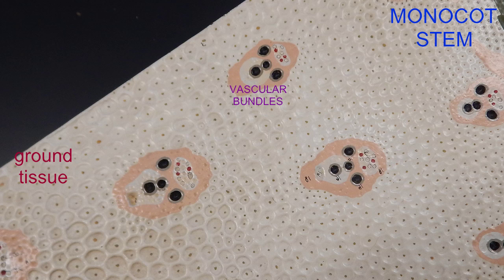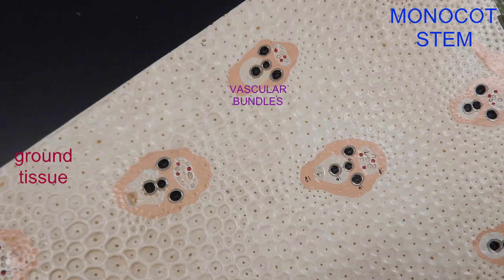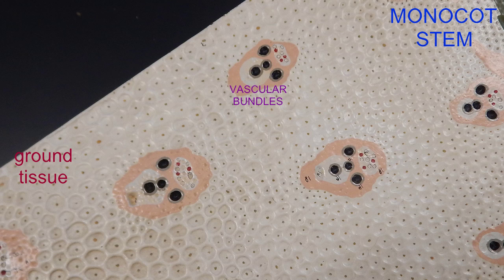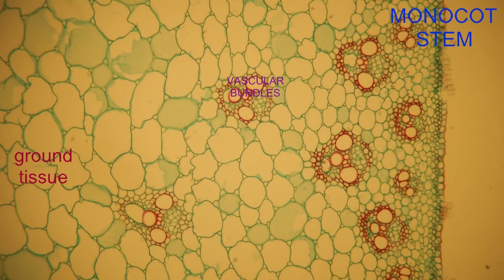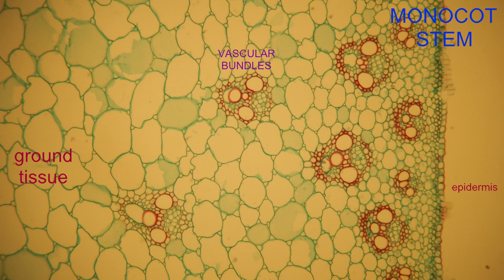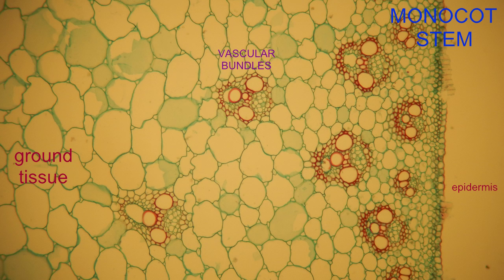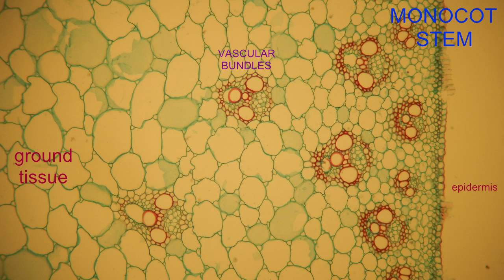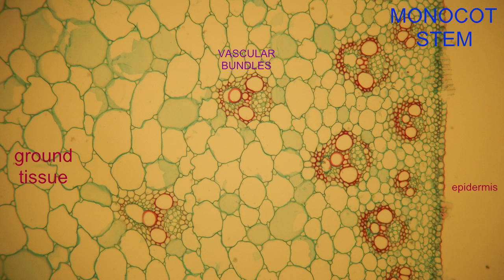Each vascular bundle possesses both xylem and phloem. The vessels in the xylem are larger cells than the sieve tube cells of the phloem and easy to identify.